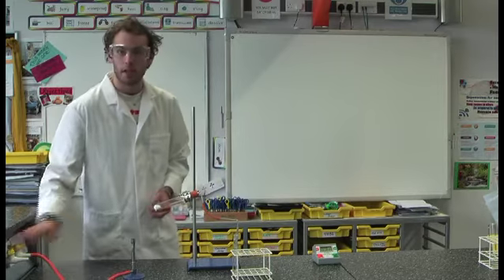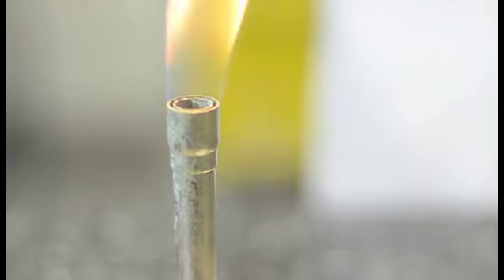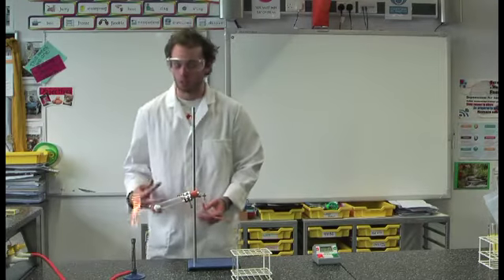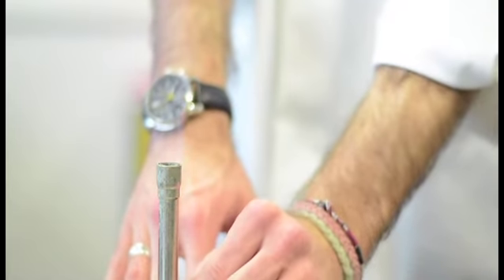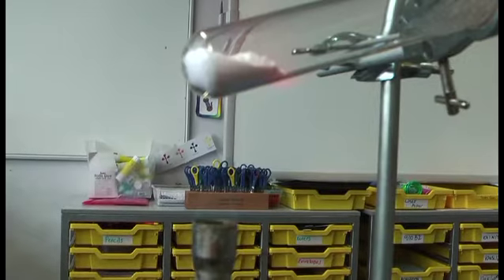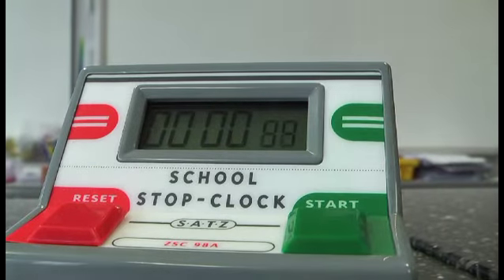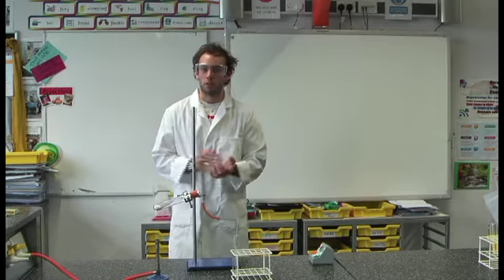Now what you're going to do is you're going to light the Bunsen and using the hottest flame which as you know is the blue flame, you're going to heat your carbonate, you're going to start your timer and you're going to see how long it takes for your lime water to turn milky.